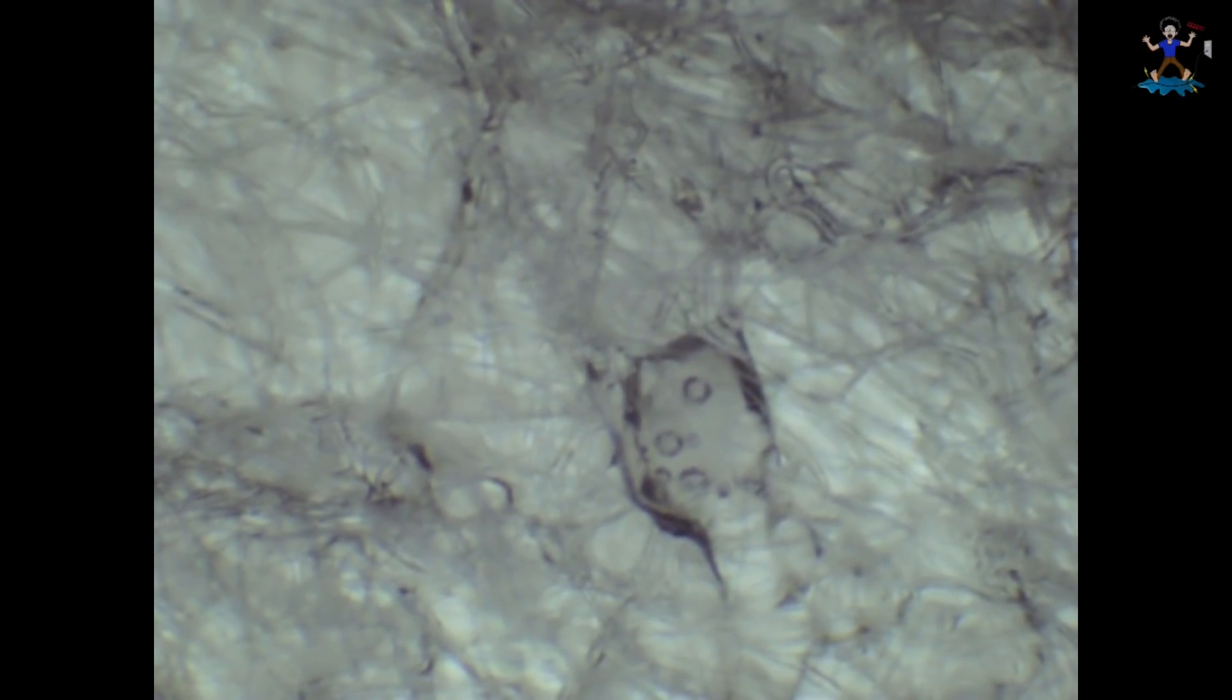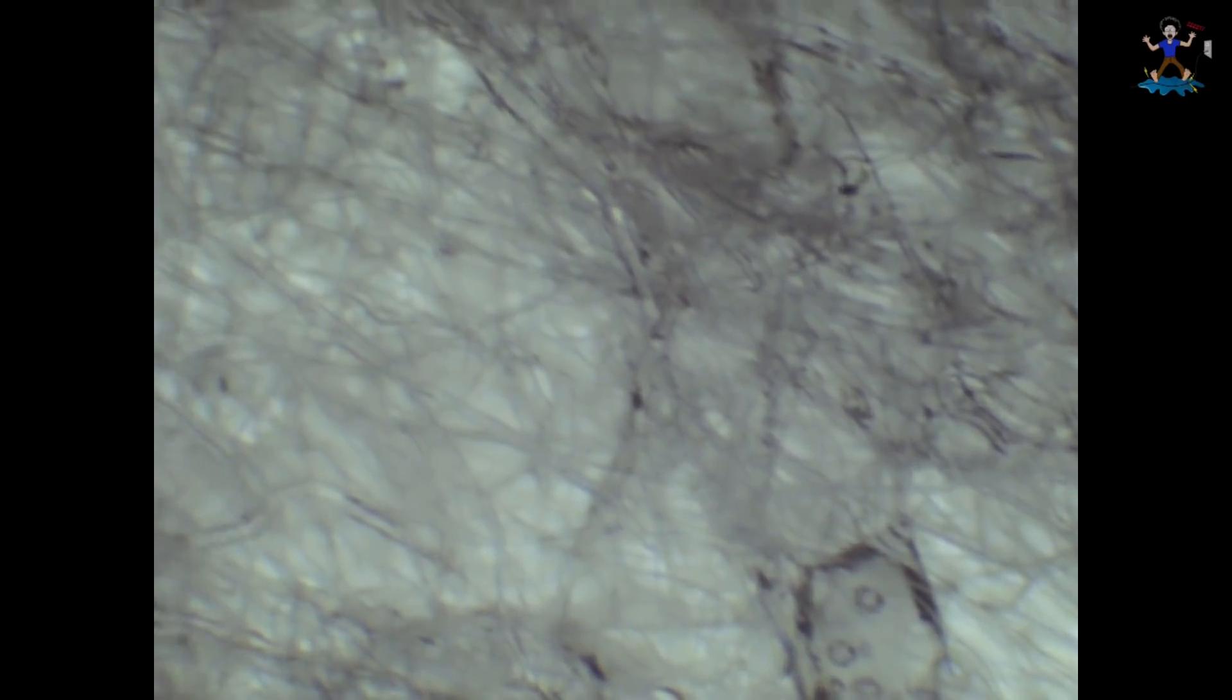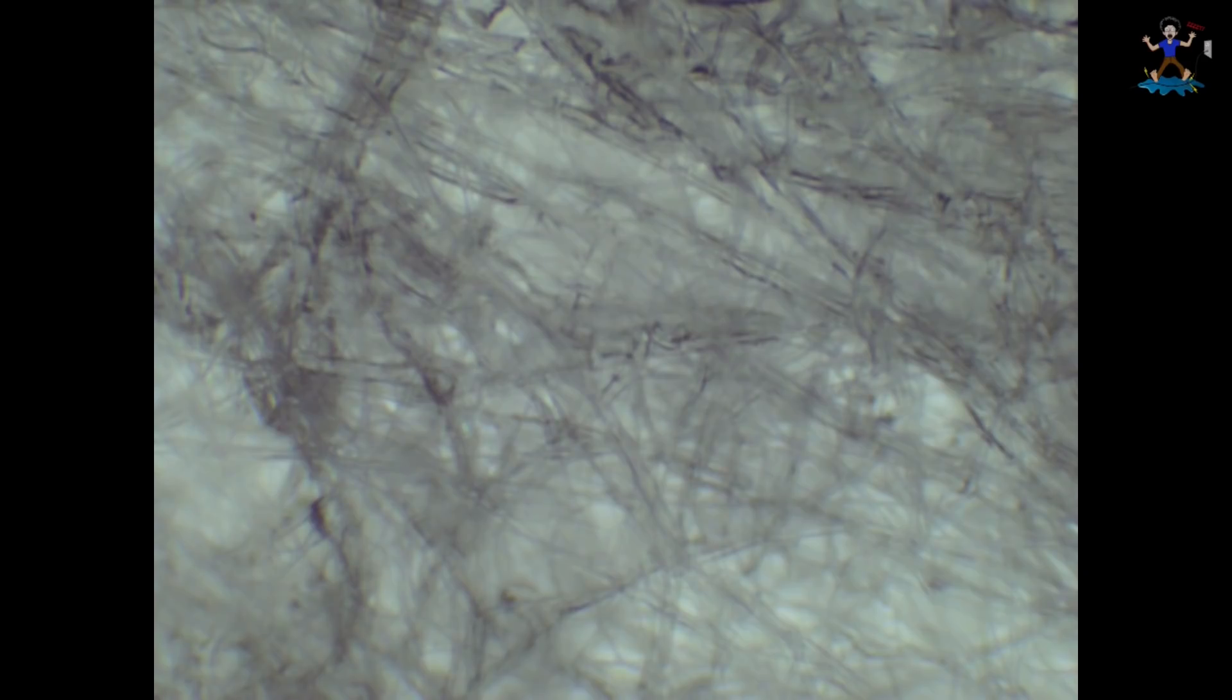40 times magnification. There are many fibers packed very tightly together, and they're much smaller. The smaller spaces along with the electrostatic treatment on the N95 mask will allow smaller particles to be trapped in these layers.